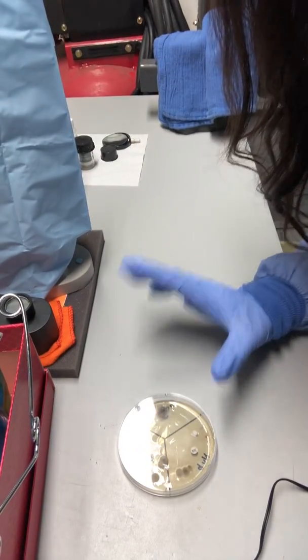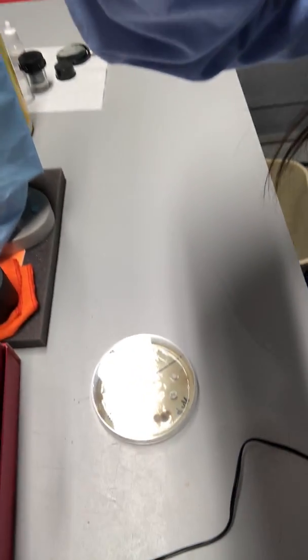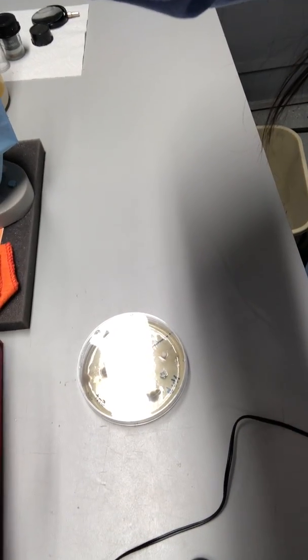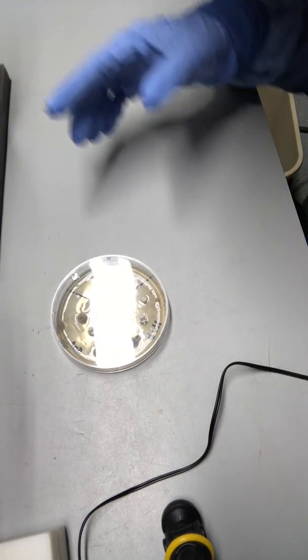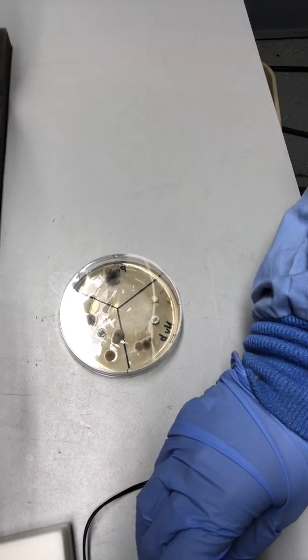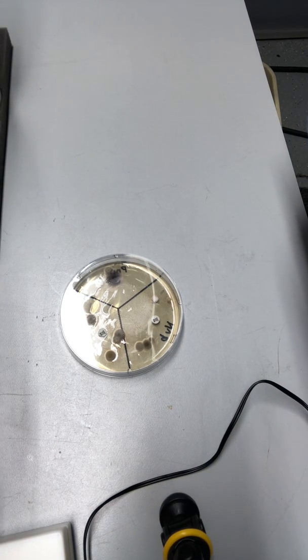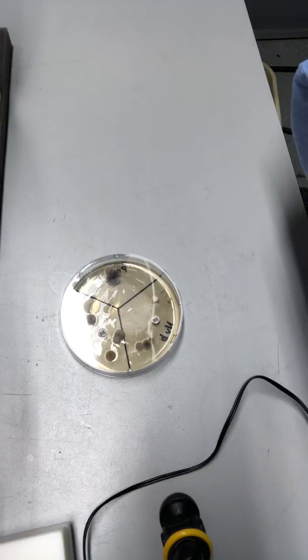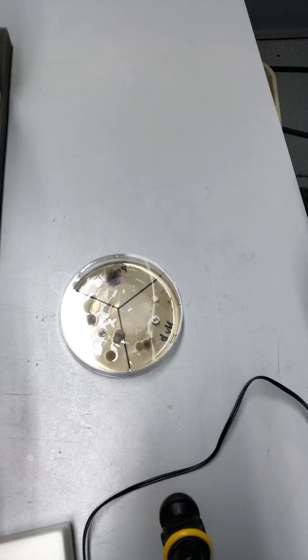As you can see, this is the agar plate that was created for this lab experiment. The whole purpose of this experiment is to do the sensitivity test by performing the Kirby-Bauer diffusion test.